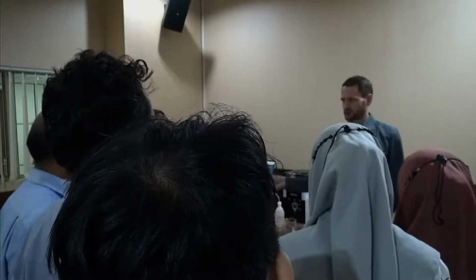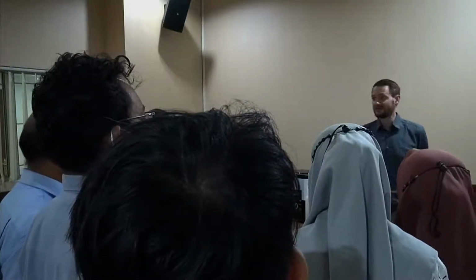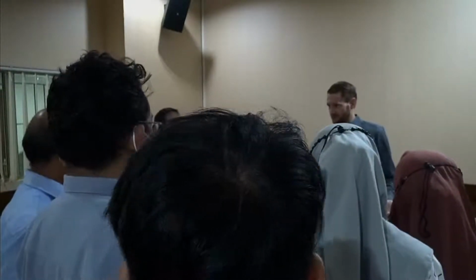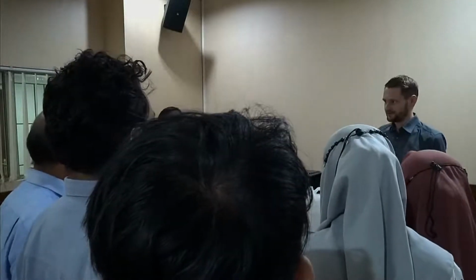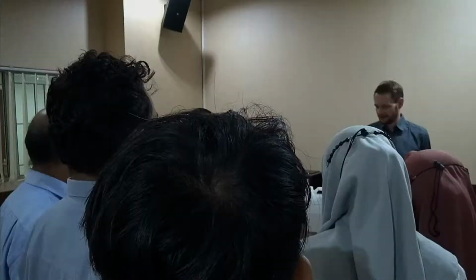So in case you ever come across strange measurements and you want to know whether it is the instrument or your sample, and you don't know offhand, go measure F500 and compare it with the final testing result. If it comes out the same, the instrument apparently is working the same way as it did when it left the company. If it is not, you apparently have a problem and should contact our service. In 95% of the cases, the simple reason for it not being the same is that it's dirty and you need to clean it. That's the most common reason.